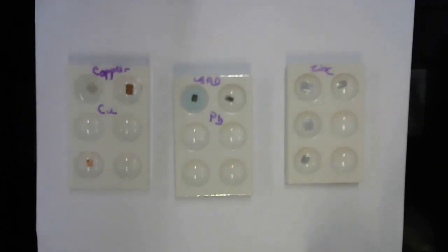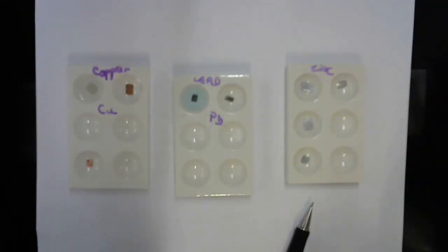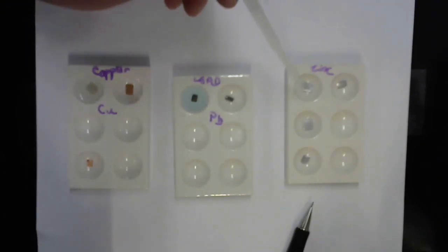Yep. Okay. Reaction number 3 is zinc. The elemental zinc. It's over here. And we're asked first to add lead nitrate to that. So I got 3 shiny pieces of zinc and another piece of zinc over there just for comparison purposes. So here's the third reaction, which is zinc metal plus lead 2 nitrate.